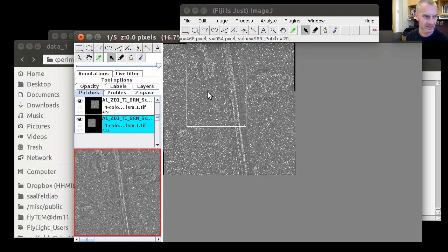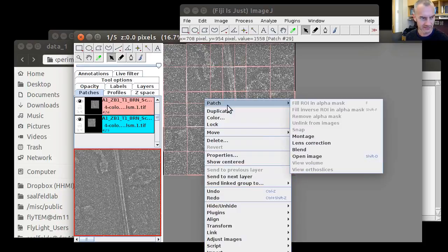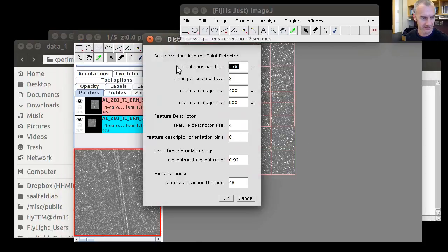So there's no center tile, but any of the close to center tiles is good as a reference. So we click that tile, then we hit Ctrl A to select all the rest, and then we go to patch lens correction to perform nonlinear lens correction. The parameters here are the same as in the SIFT feature dialog that you've seen before for montaging.